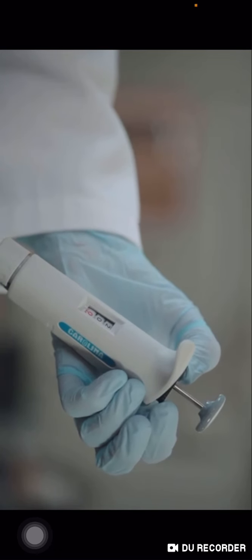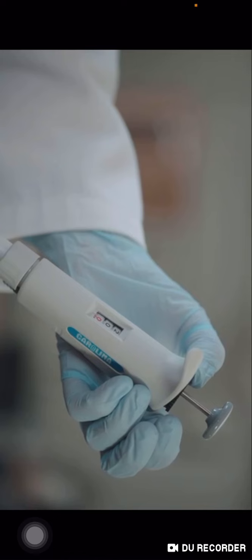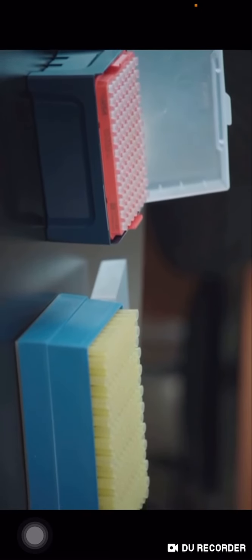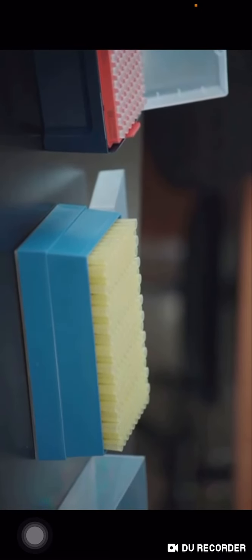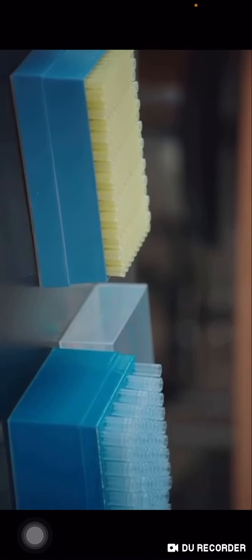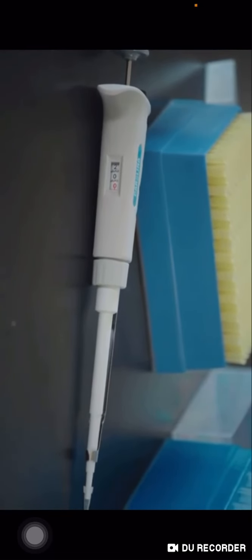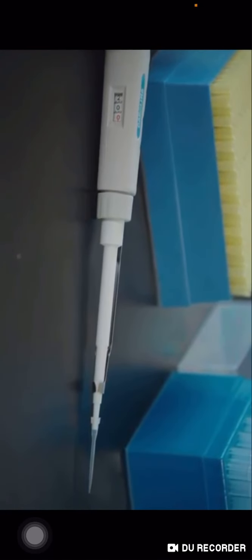First, we set the volume. To set the volume on the P20, gently pull up and turn the black wheel, as shown in the video, to 20 microliters. After adjusting the pipette volume, push the black wheel back down. Do not ever adjust the pipette volume outside the range, as this will damage the micropipette.